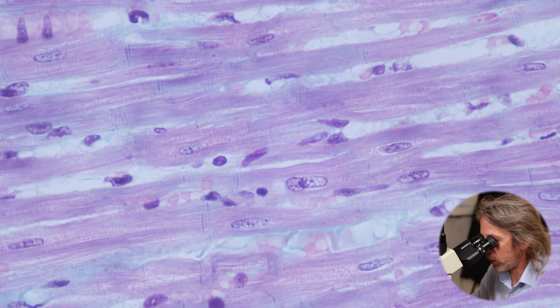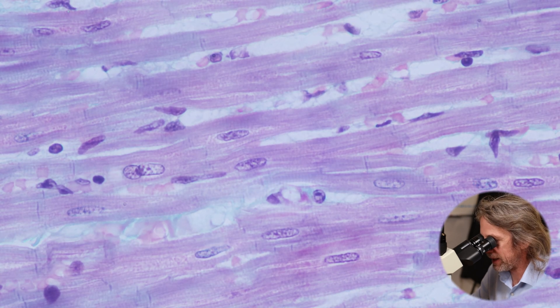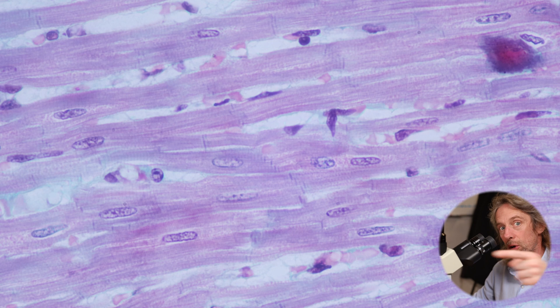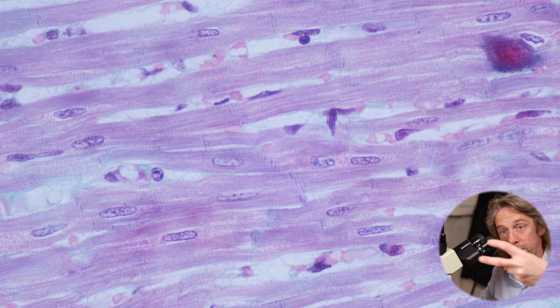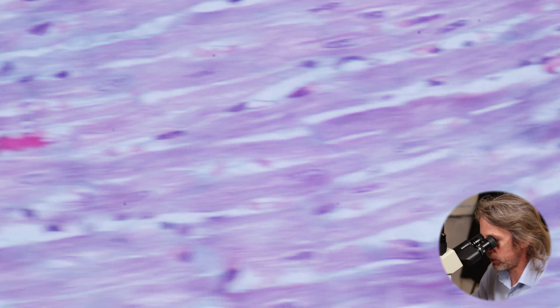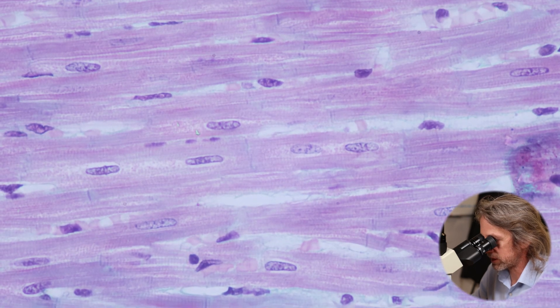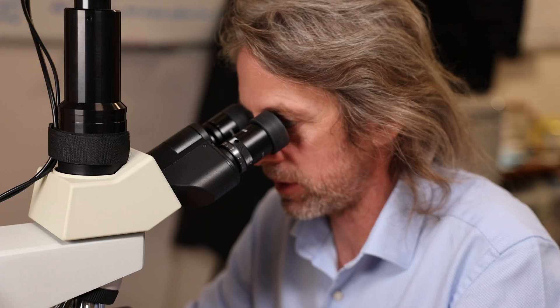We can clearly see how the nuclei are inside the cell, interrupting the contractile machinery, and we can clearly see how those lanes of cardiomyocytes are linked by bridges — sometimes one cardiomyocyte gives off two bridges to meet two new cardiomyocytes. It's called striated muscle because we see these stripes. It's similar to skeletal muscle — same contractile elements and sarcomere structure — but different because these cells are short.